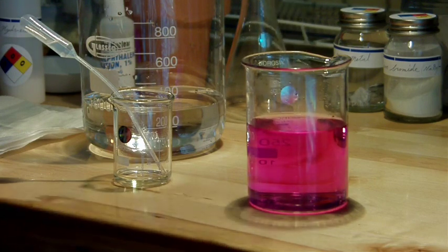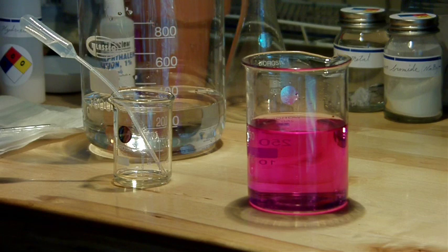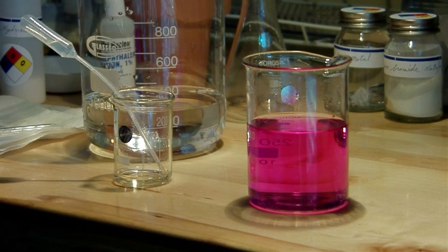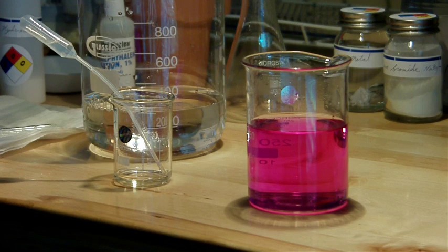And there it is, titration complete. I may have added a few more extra drops because that's actually a pretty dark pinkish color. But you can see it's a really good indicator of when the equivalence point is reached because it's such a dramatic change in color.